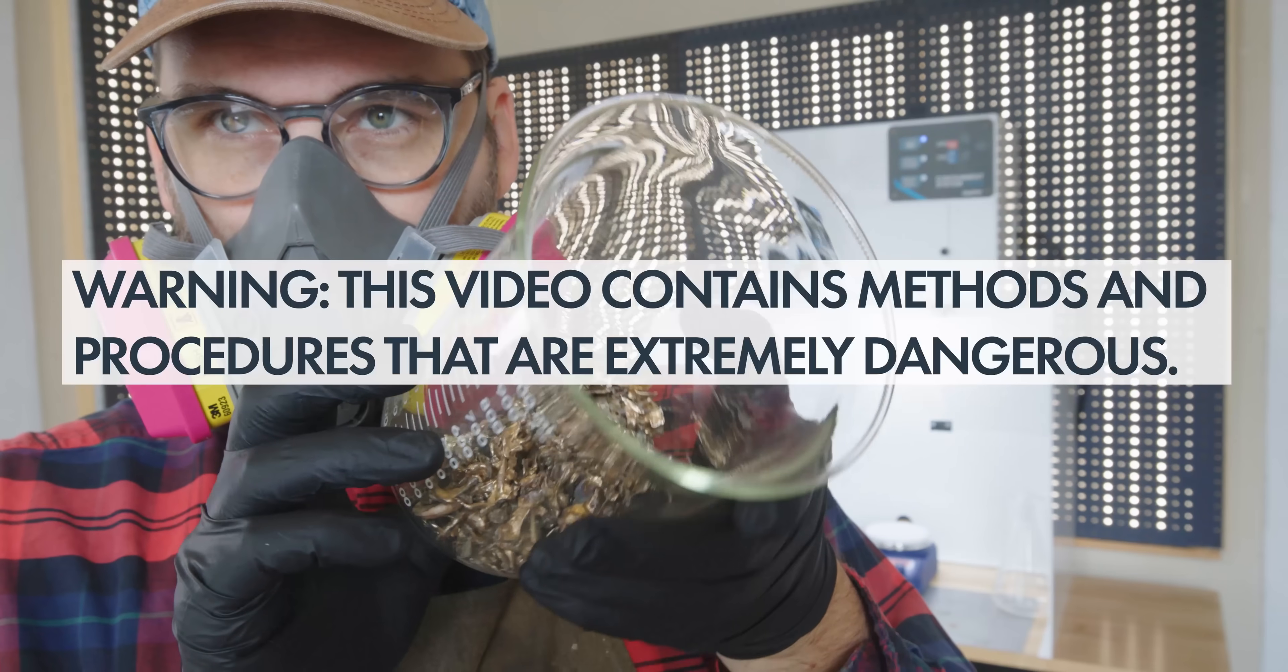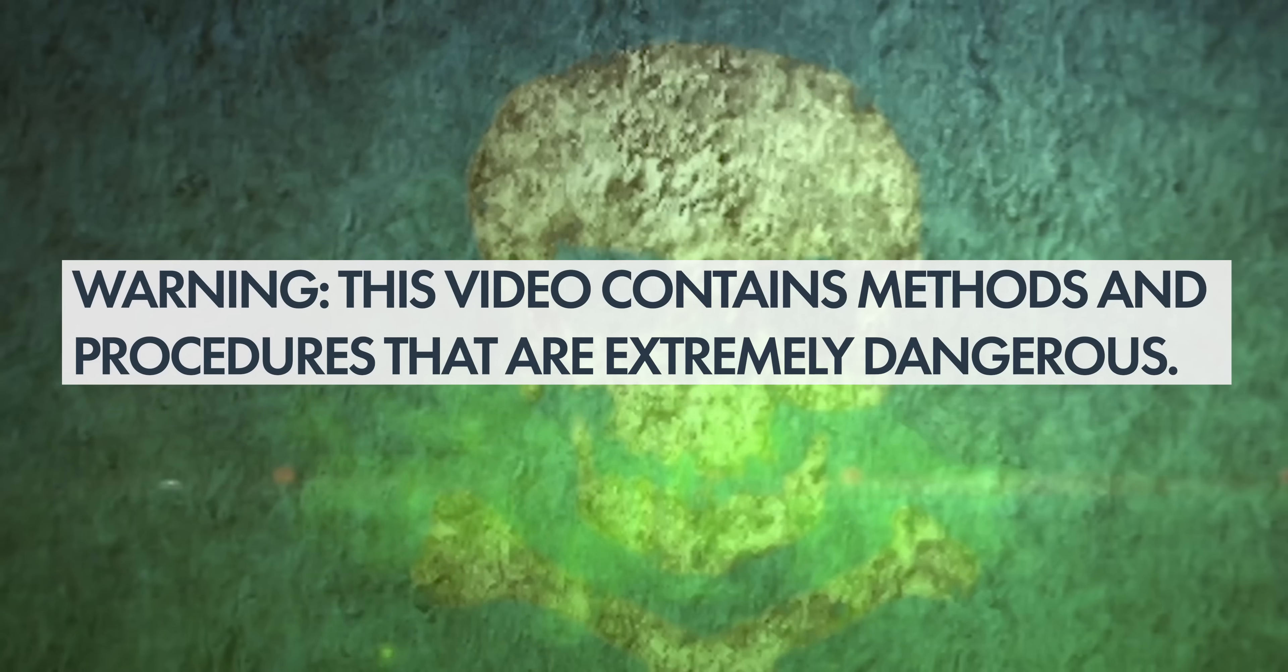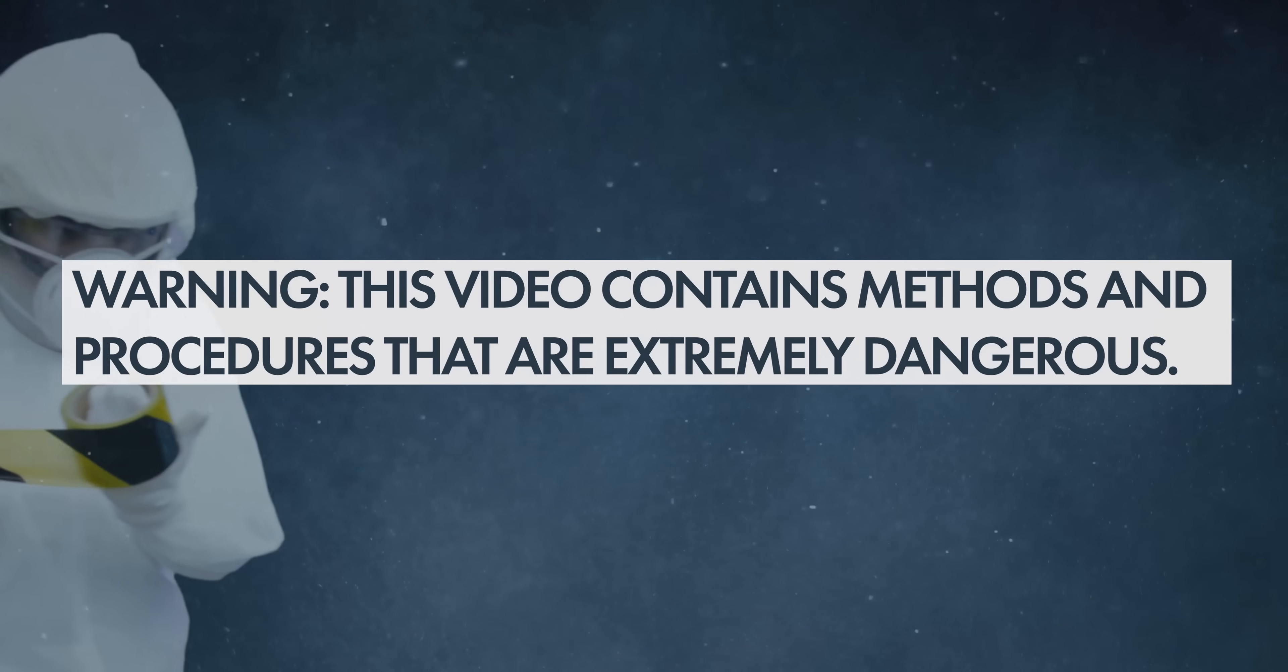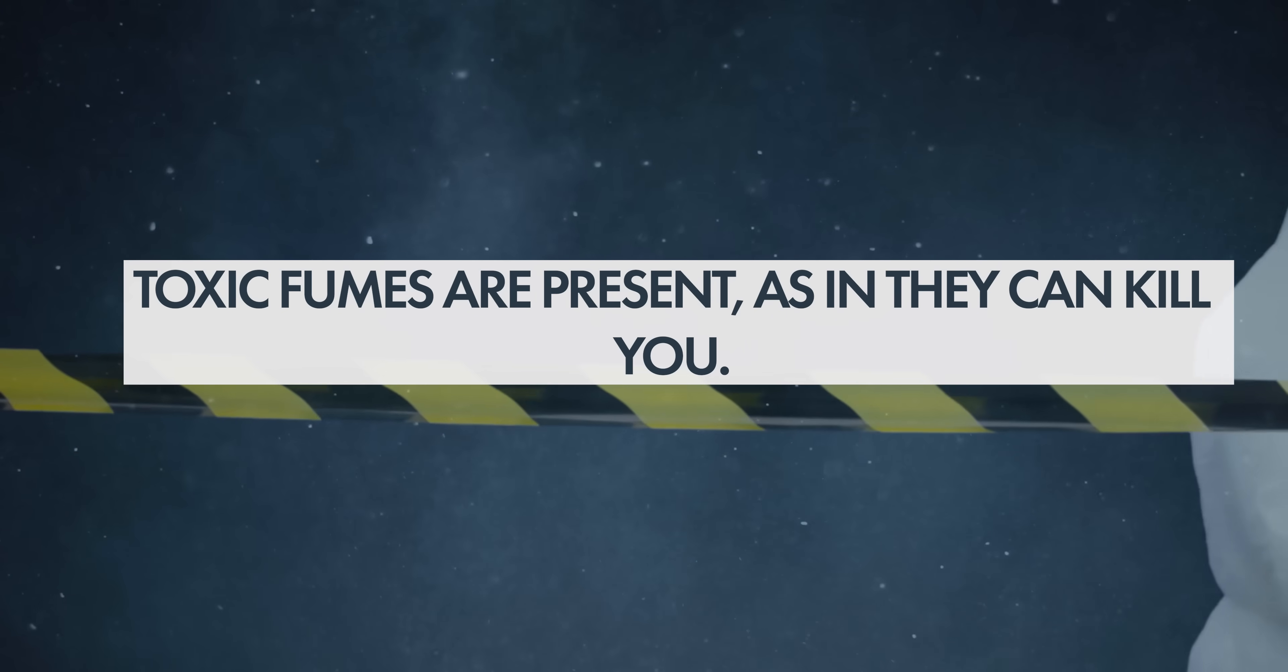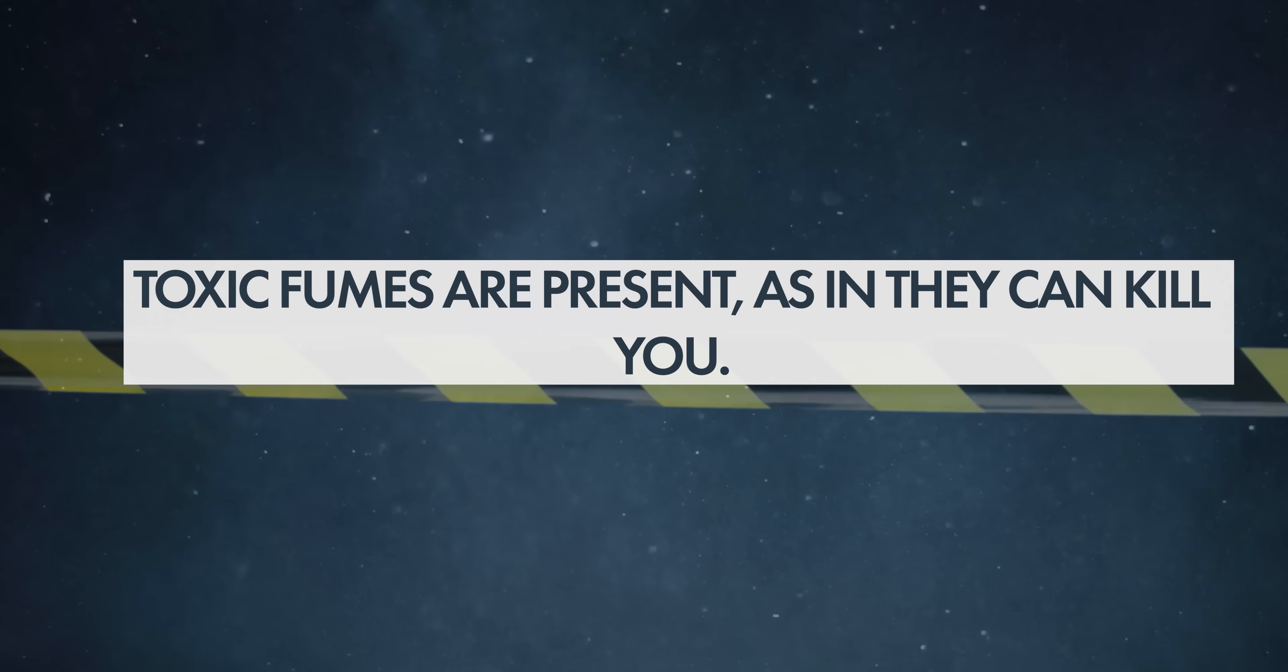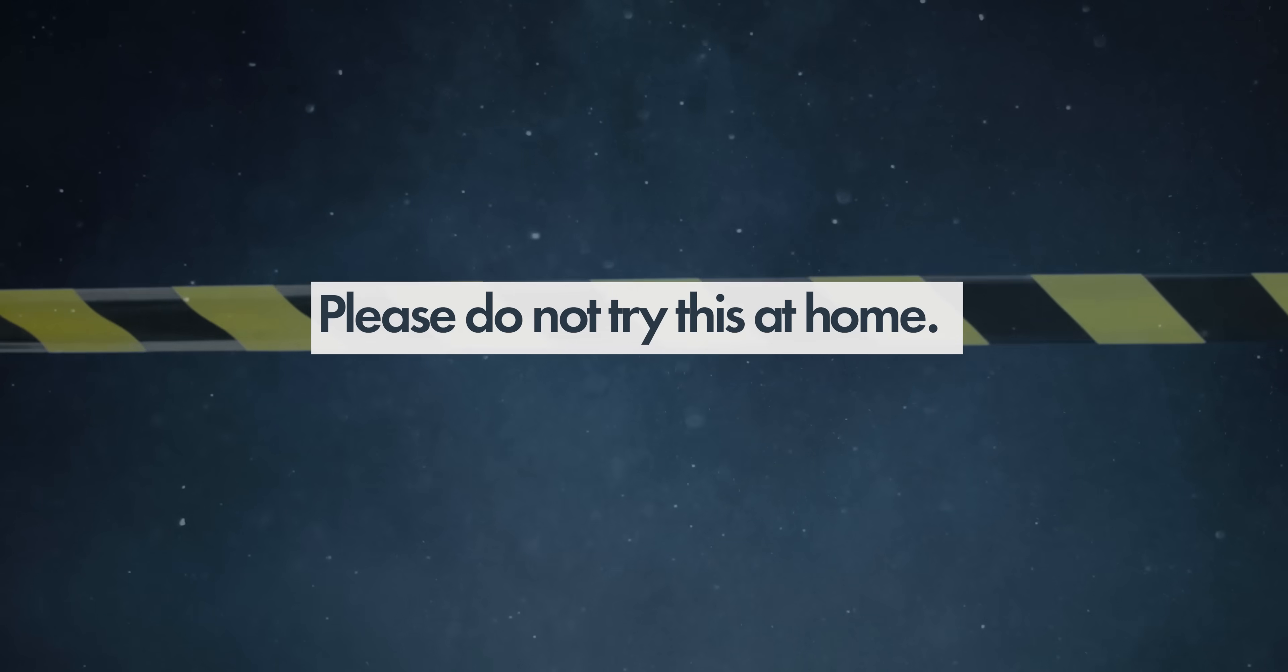It's time for the chemistry. Warning: this video contains methods and procedures that are extremely dangerous. I'll be handling acids that are incredibly corrosive. Toxic fumes are present - as in they can kill you and that's bad. Please do not try this at home.